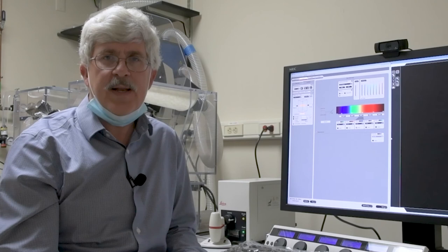After the stage initialization the software continues to this point which is its initial startup screen. In part two of our videos we're going to take a look at the details that you need to know for putting a slide on the stage and finding something to image.